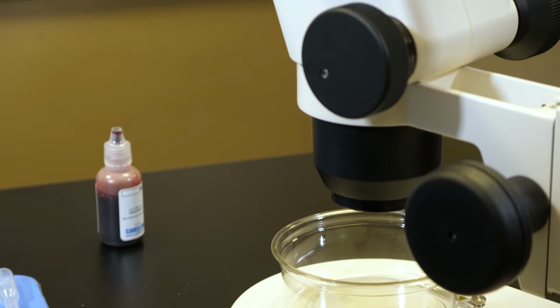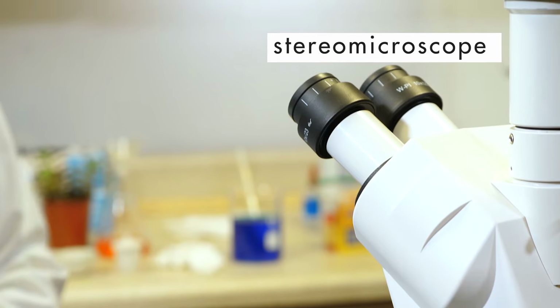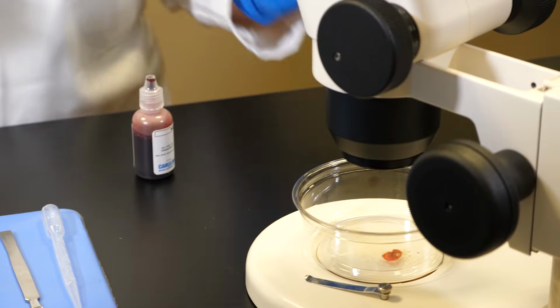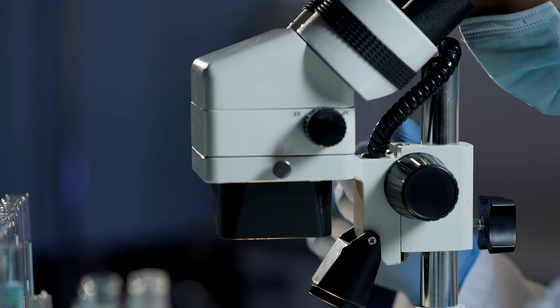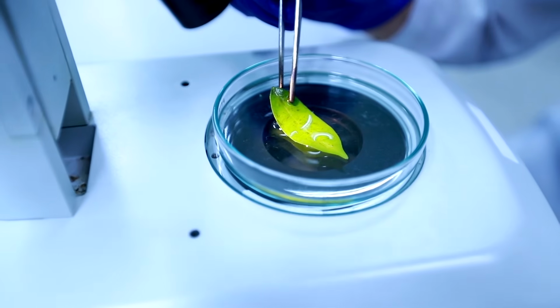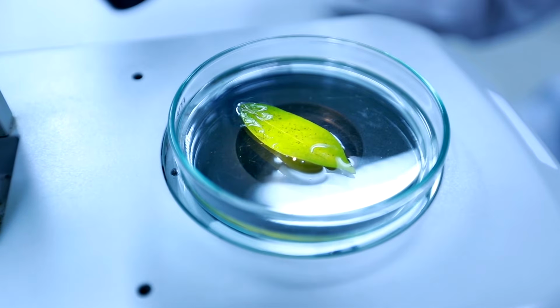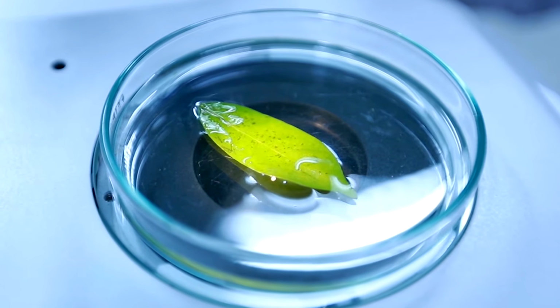Another kind of optical microscope is a stereo microscope, which is also called a dissecting microscope. If you recall, a stereo microscope was used during the lab in which we dissected a chicken egg. A stereo microscope uses a series of lenses to produce a three-dimensional image. This type of optical microscope is used to magnify the image of objects that are not transparent. It is also used to magnify objects that are too large to be viewed with a compound microscope. Stereo microscopes can magnify an image up to 40 times.